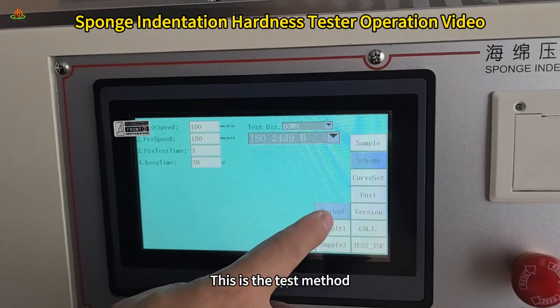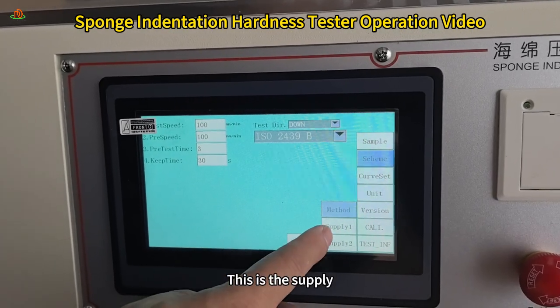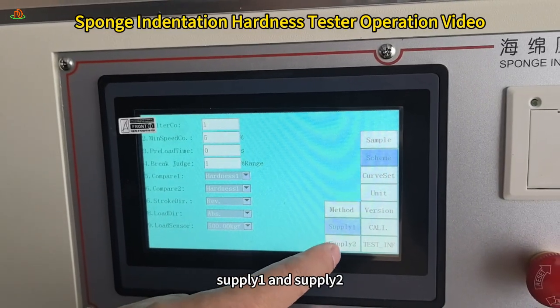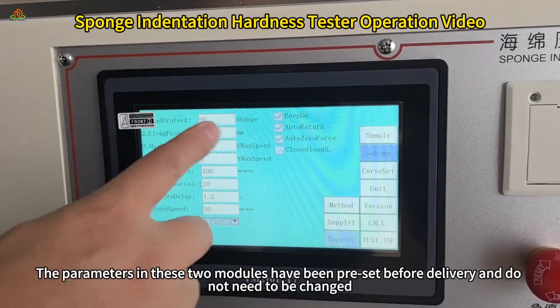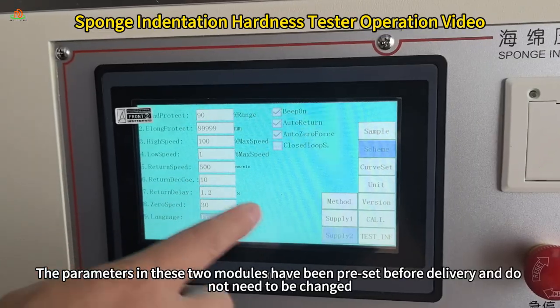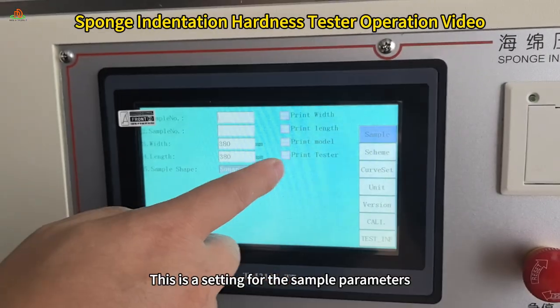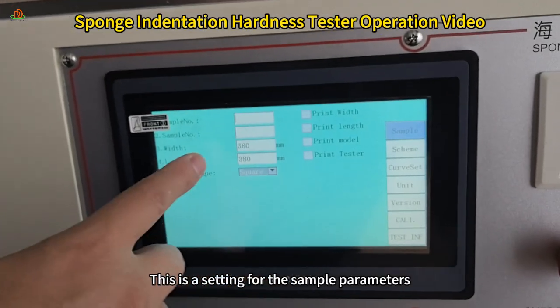This is the test method. This is the supply. This is the control part of our equipment, supply 1 and supply 2. The parameters in these two modules have been preset before delivery and do not need to be changed. This is a setting for the sample parameters.